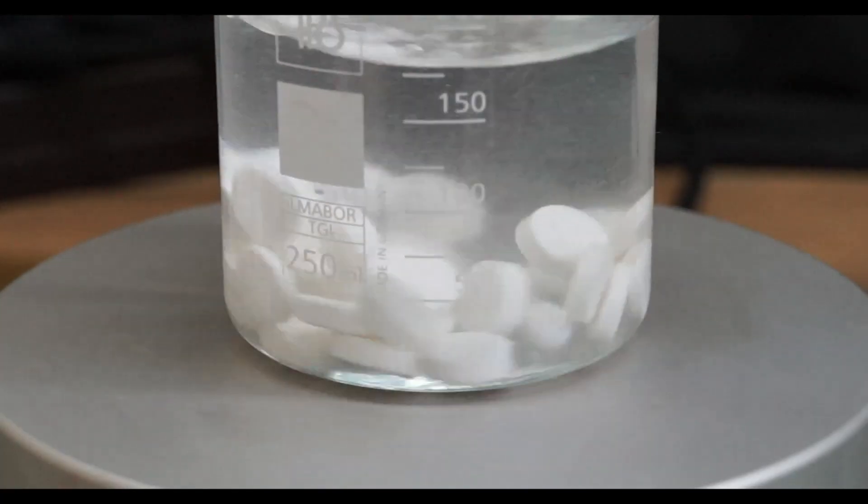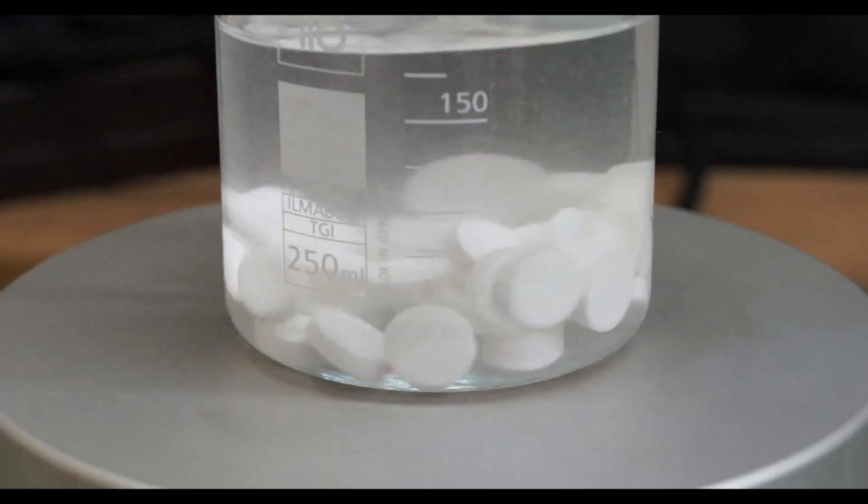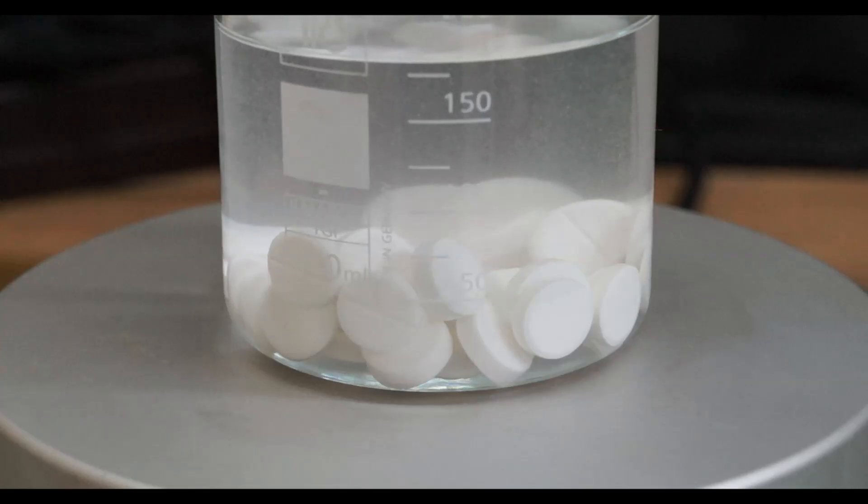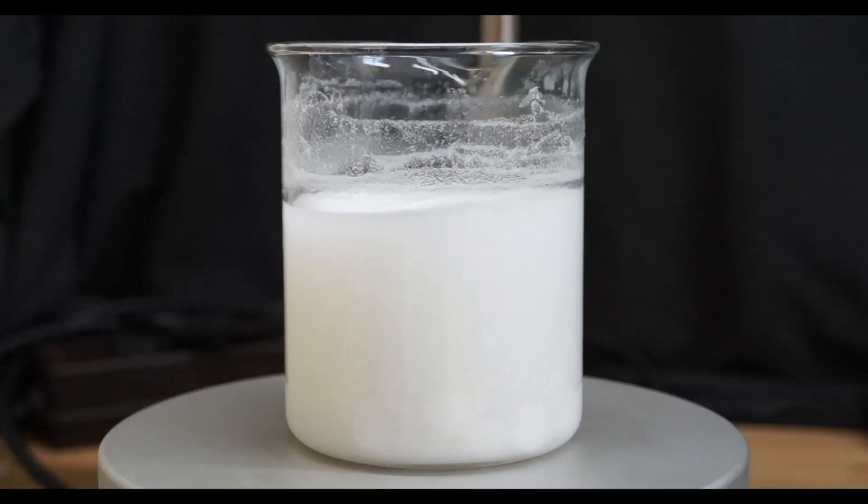As you can see at the beginning I had some problems with the stirring and off camera I had to stir the mixture for a few minutes with a glass rod until enough of the tablets dissolved so that the stir bar began to function properly.